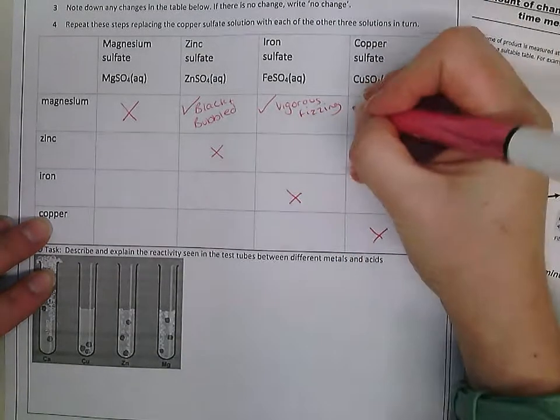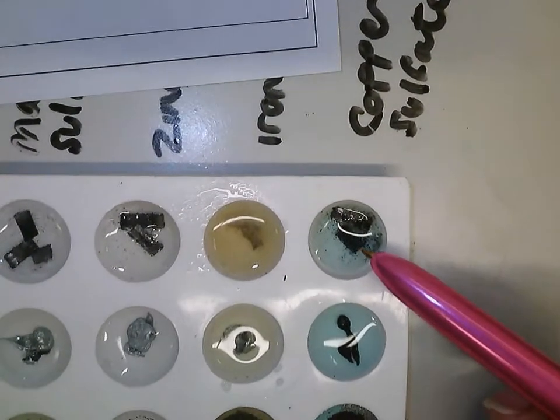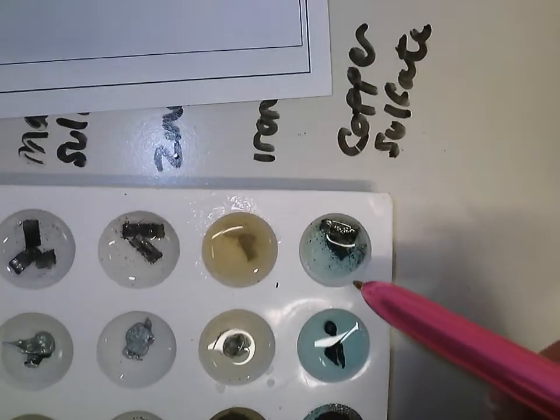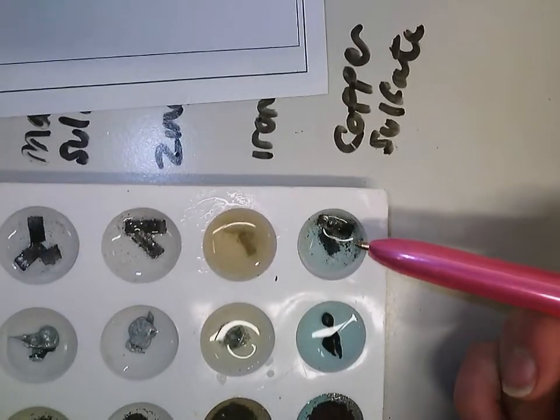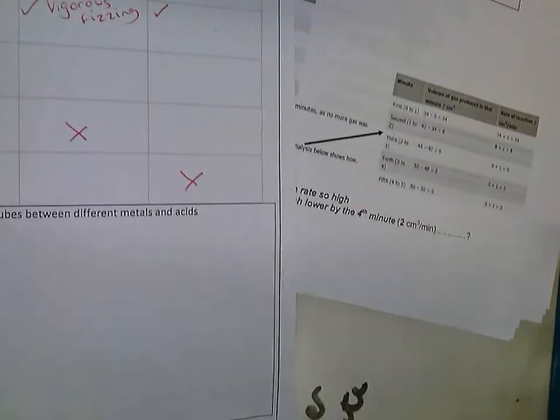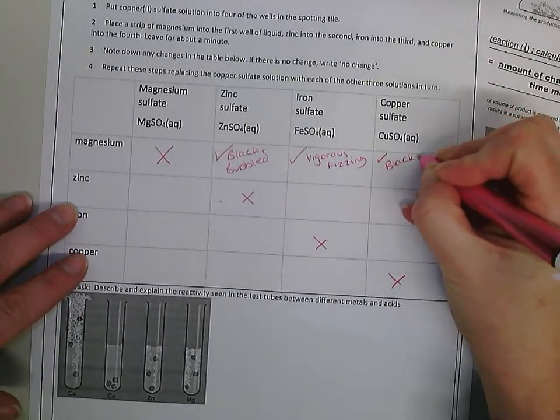And some smoke. This one reacted again, so you can see it's almost broken down the magnesium completely, so you can see it's forming all these black bits. That's the copper metal forming, and the magnesium is breaking down. Eventually this will stop being blue and it'll actually go colourless, the same colour as the original one of magnesium sulfate, so this colour, as it breaks it down. So here, it turned black and fizzed.